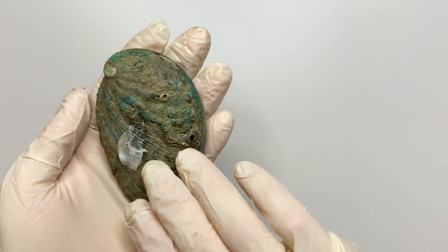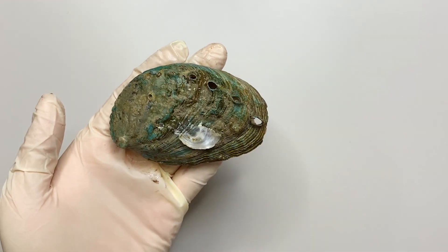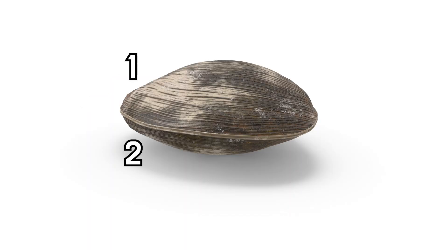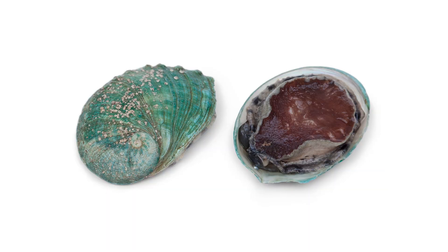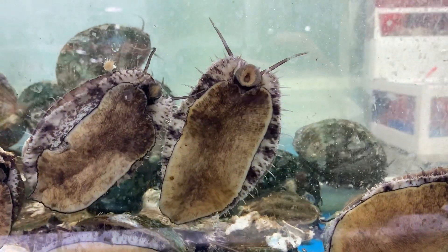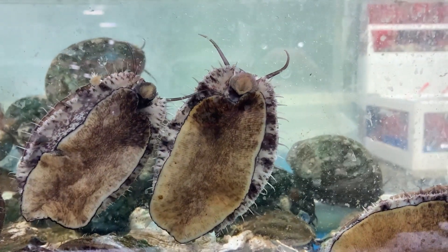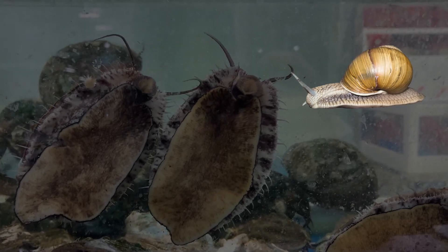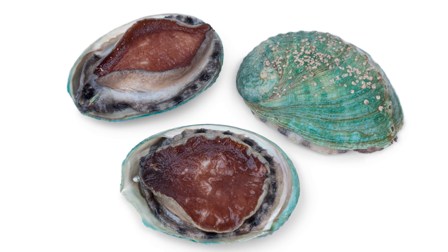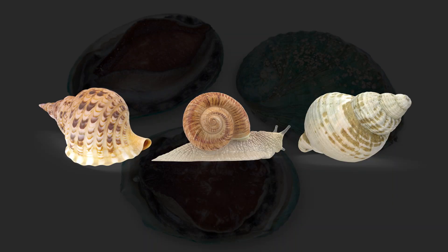Abalone is mistaken for bivalves like clams because of its flat shell, but it is not a bivalve. Bivalves have two shells, but abalone has only one shell. In fact, abalone are creatures much more like snails than bivalves — it is a type of sea snail. Abalone belongs to gastropoda along with snails, conch, and trumpet shell.